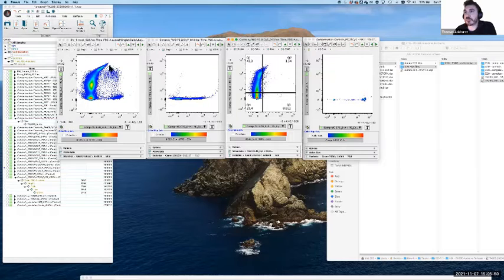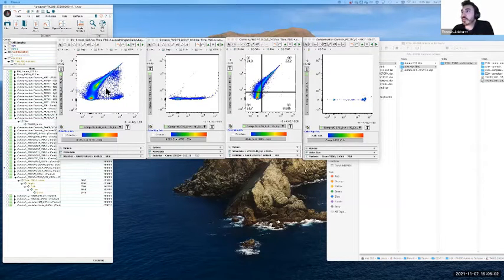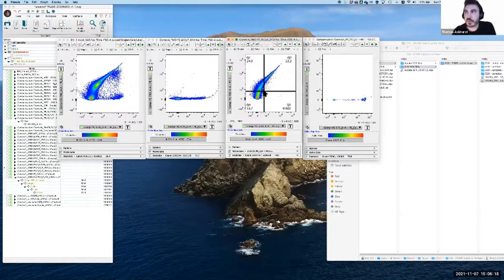And so, like before, we lean on the FMOs to give us some kind of instruction. If I just modify this a tiny bit to make the effect much clearer, a little bit more excessive. If we look at the FMO in particular, there is no NK1.1 signal, no PE-Cy5 signal in this sample at all. We've physically not added the antibody, so that detector should have no signal whatsoever. If we're getting a situation of undercompensation, with that classic lean to the right, we're going to start seeing PE-Cy5 signal show up in the FMO. And it is because the PE-Cy7 is pushing across into that detector.